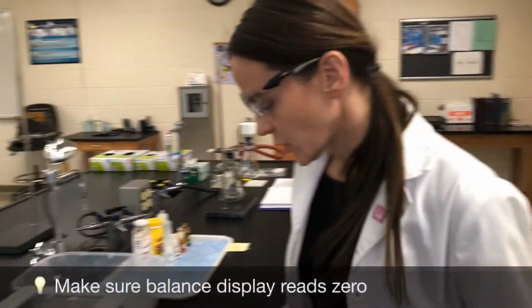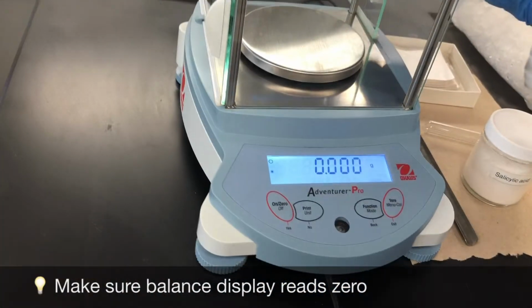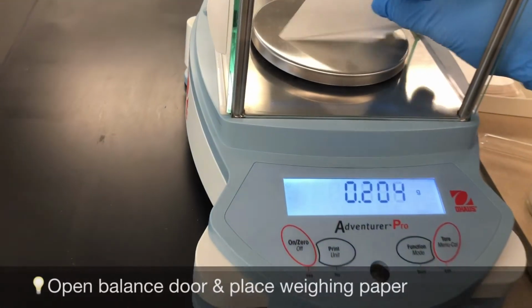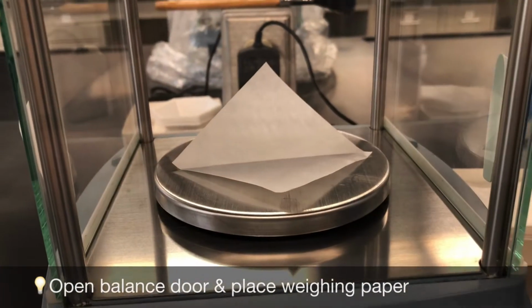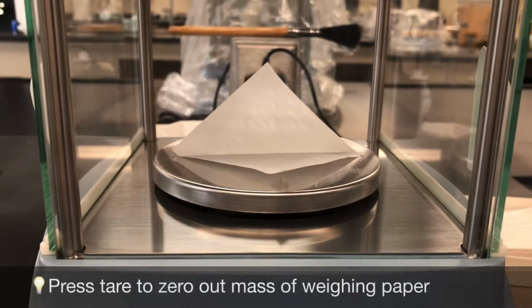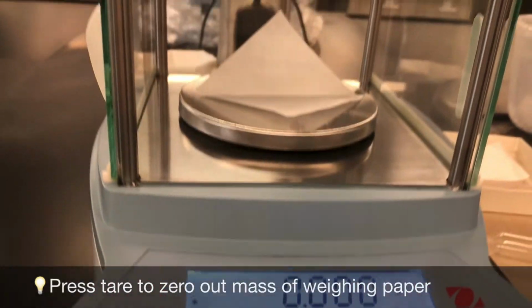So next you would look on the balance display and it's reading 0, so that's perfect. I then open the door. I put the weighing paper on the center. Okay, close the doors and tare the mass of the weighing paper. Okay, so now the display is back to 0.